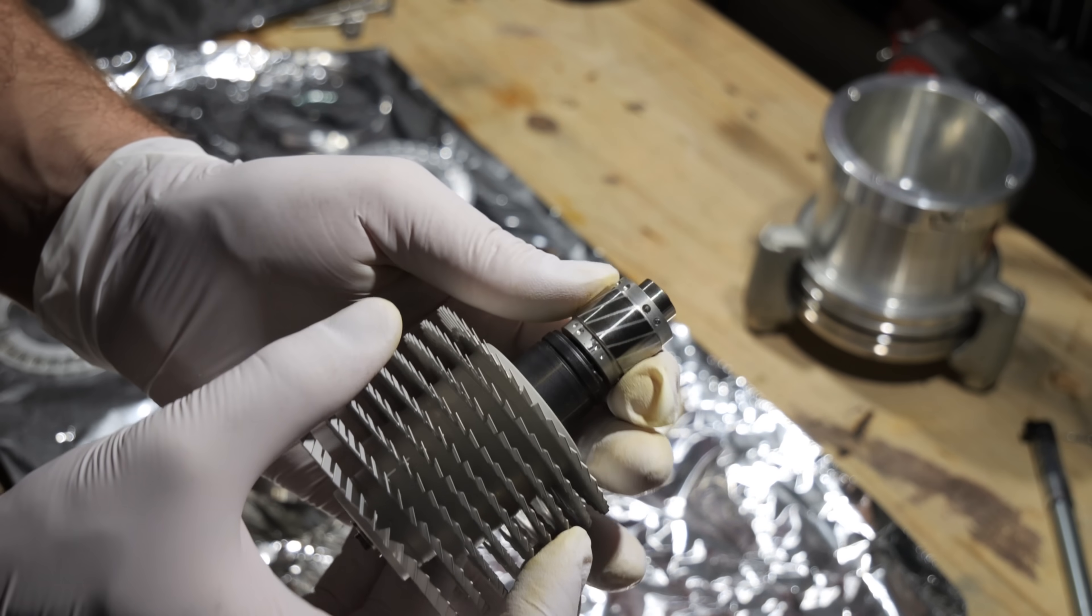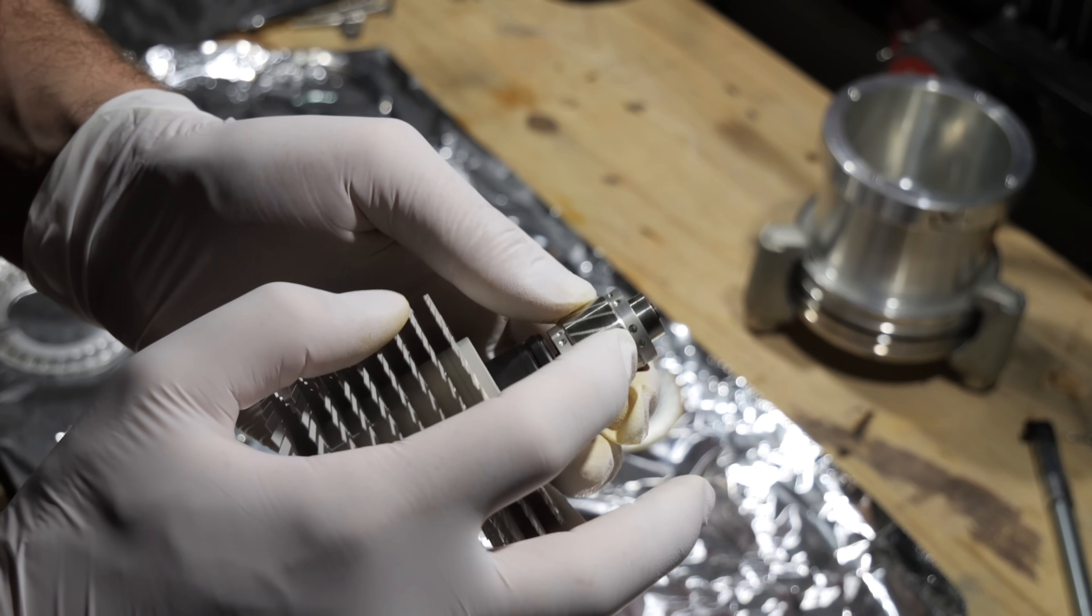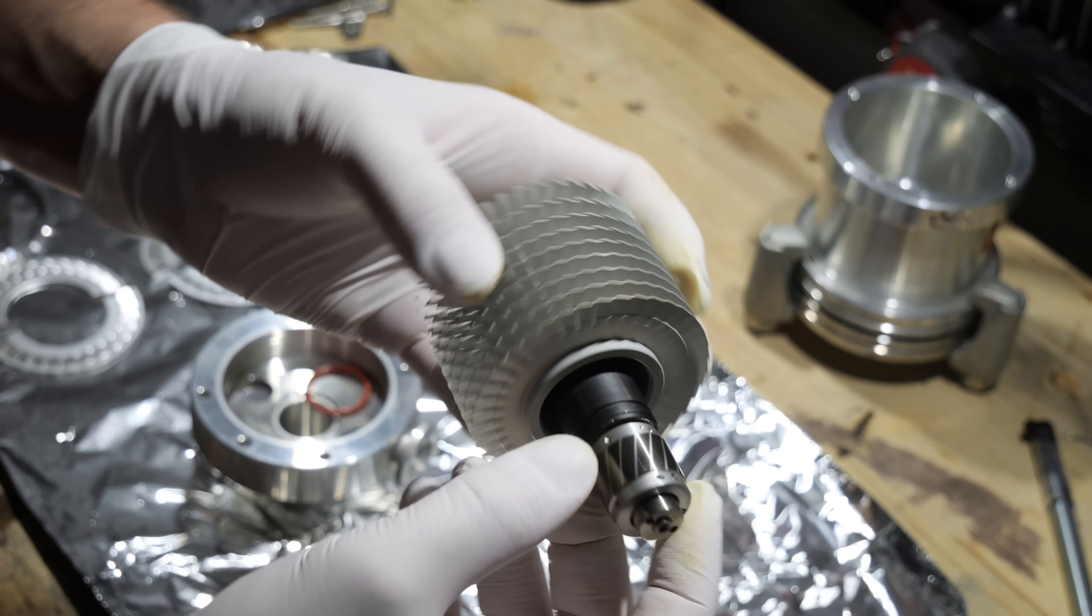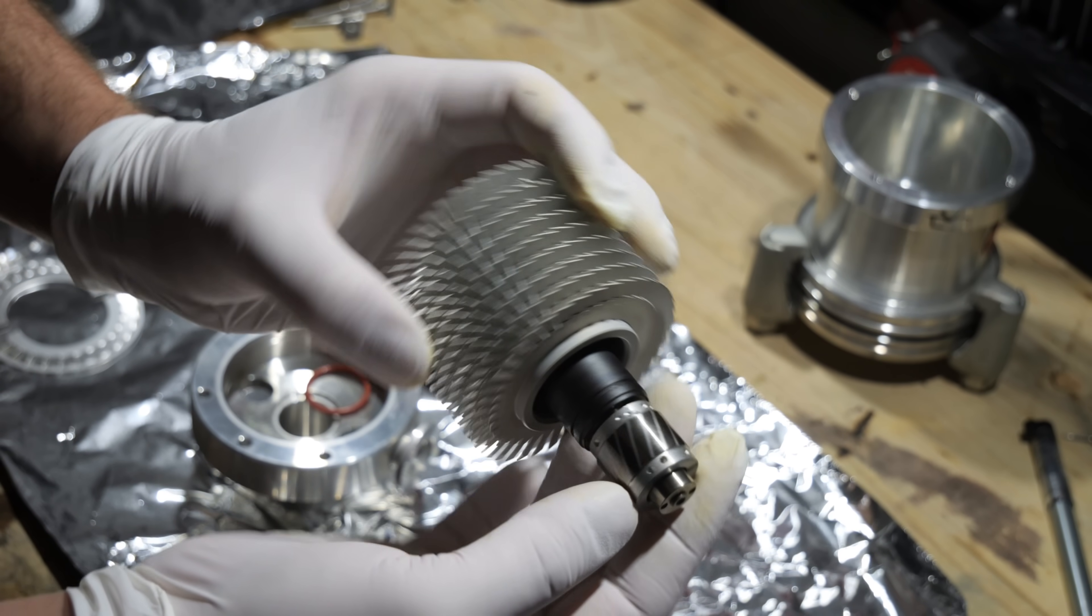What I think is interesting is that the rotor was balanced by drilling at the top and at the bottom, not by using screws or laser balancing. I think it's pretty evident that this is an older pump.